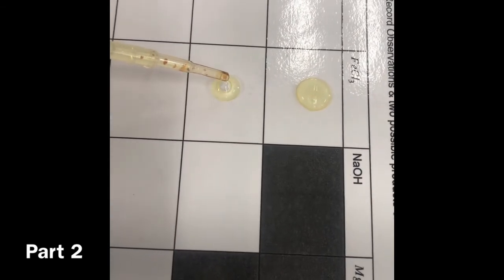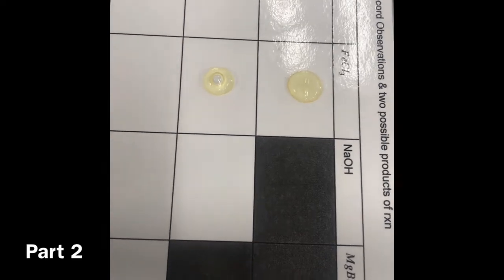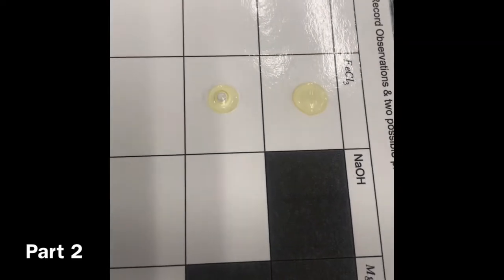Alright, guys. Next reaction. Okay. Should we just go down the FeCl3s and do all of them? Sure. FeCl3. Alright. Let's put 3 drops. My camera's moist. Come on, bro. Pop that bubble. 1, 2, 3. I really don't like that bubble, but can't touch it. So, okay, and then MgBr.